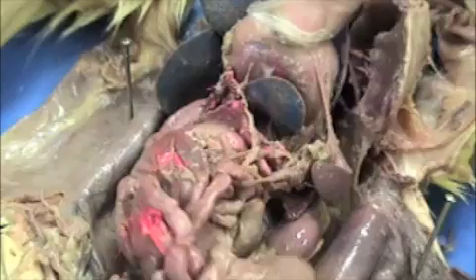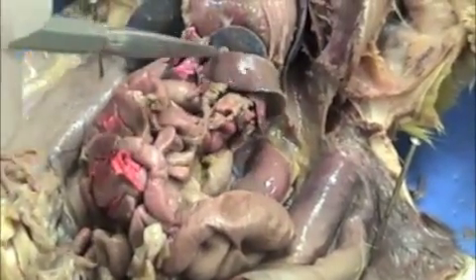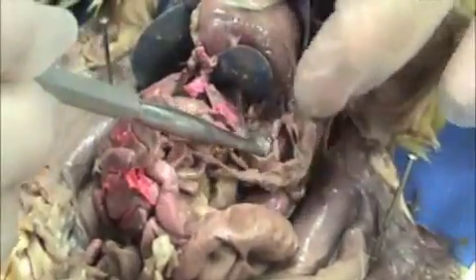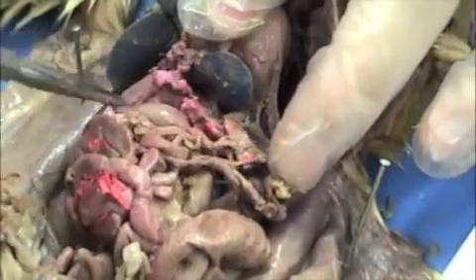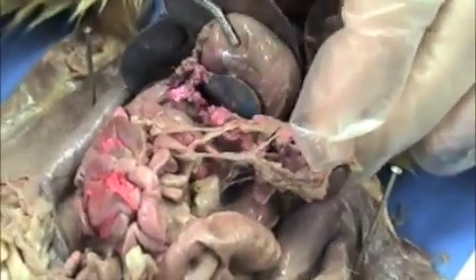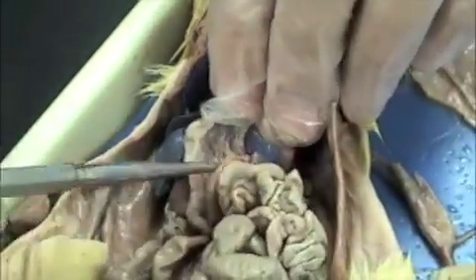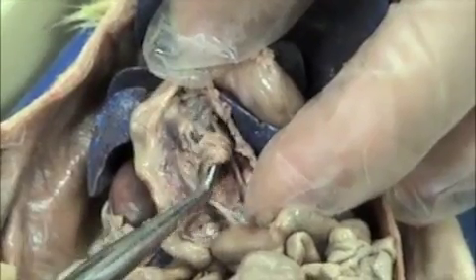We need to look at the spleen. If we lay the organs here, you see that brown, long, straight thing right there — that's the spleen. If you look at what is attached to the spleen, a lot of it looks like mesentery. But if you look a little bit closer, you can see this structure here has a lot of light brown in it and a lot of red latex in it too. See this brown right here? It's mixed in with the mesentery — that's part of your pancreas.